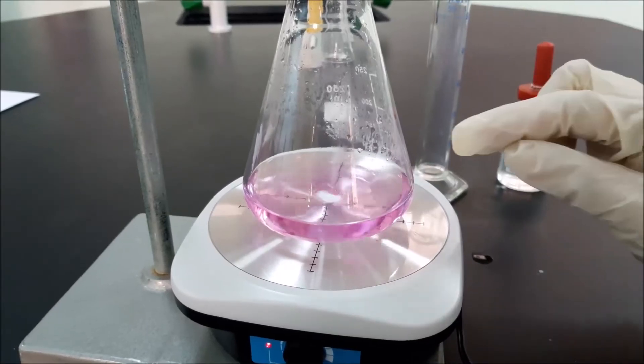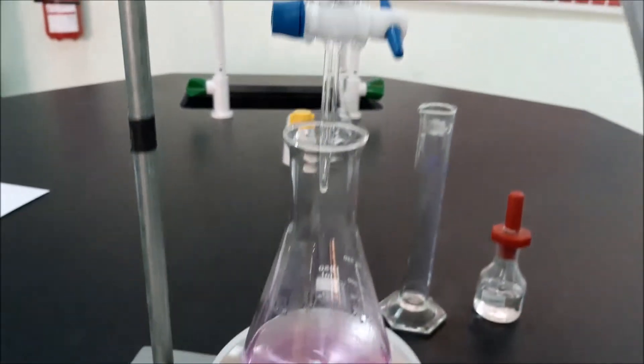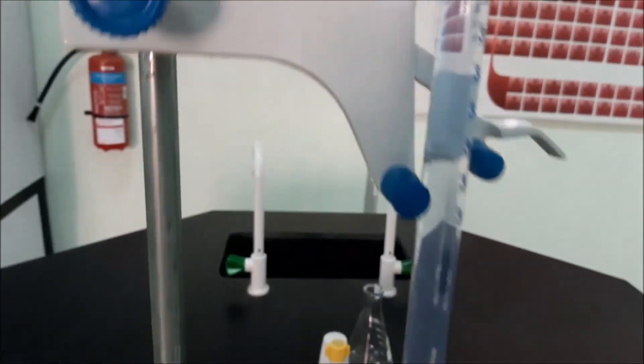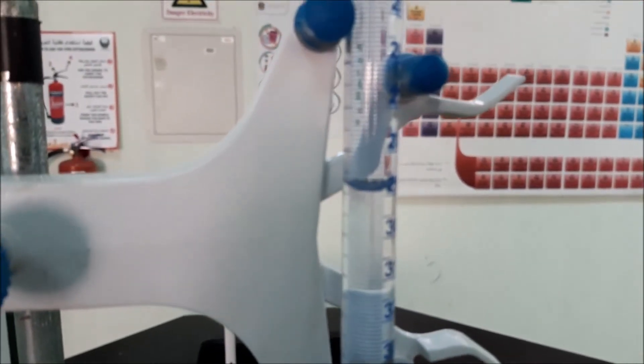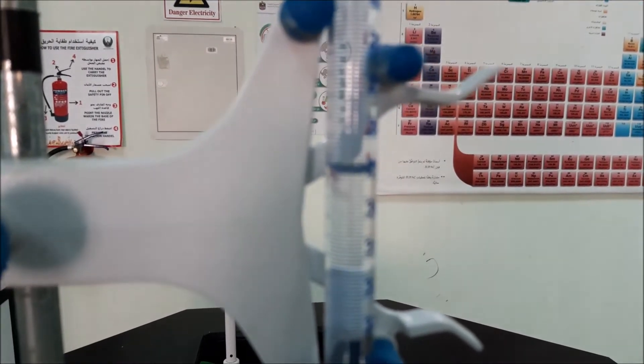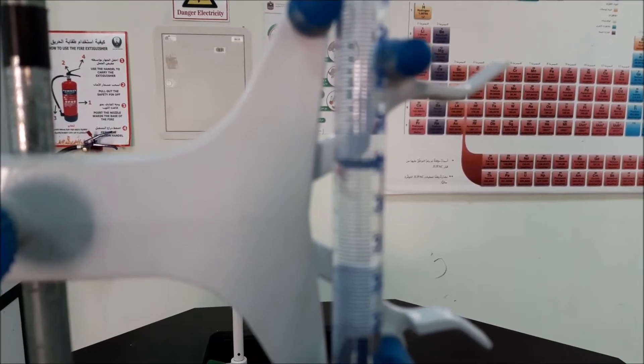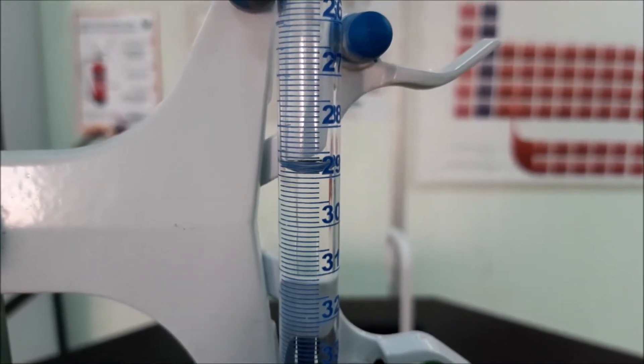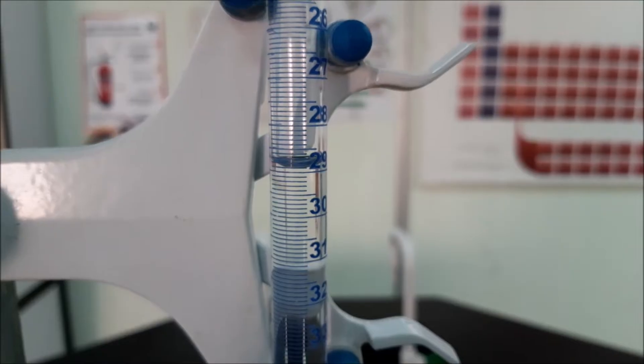Now, we can see it changes color. Our final reading is 28.90 ml.